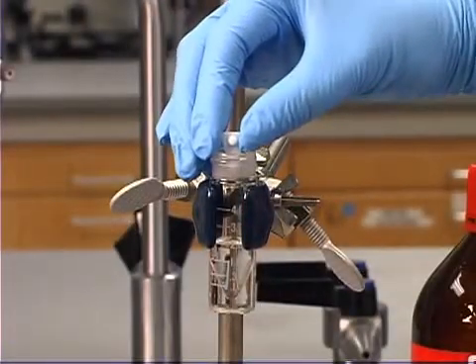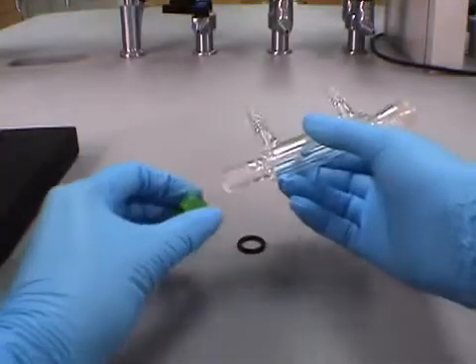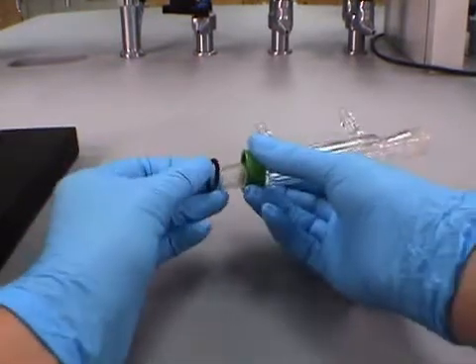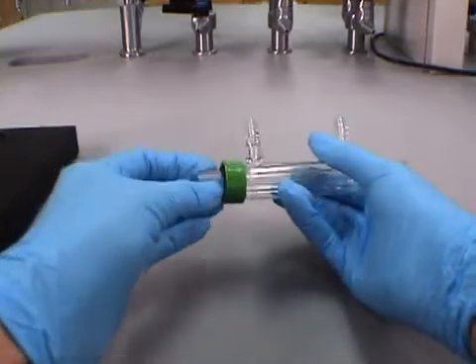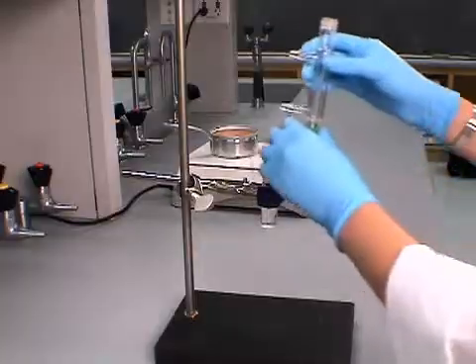Place the stir vane in the conical vial with the point facing down. The reflux condenser is assembled by placing an O-ring on the condenser so that the thread adapter is secure, and connect the condenser to the reaction vial.